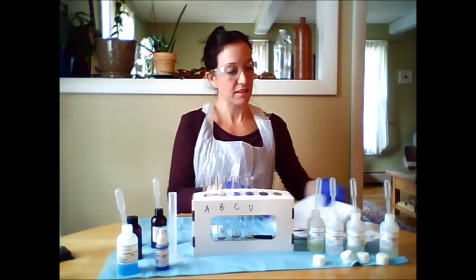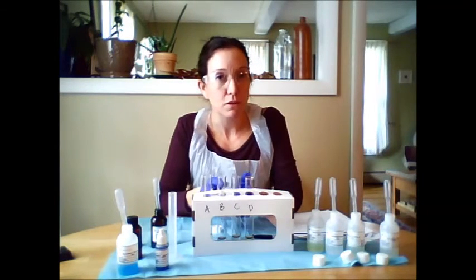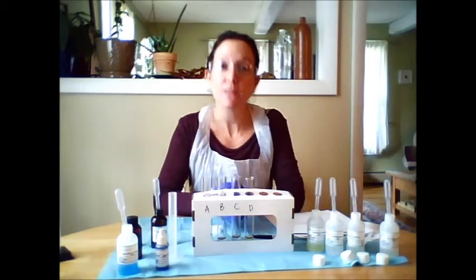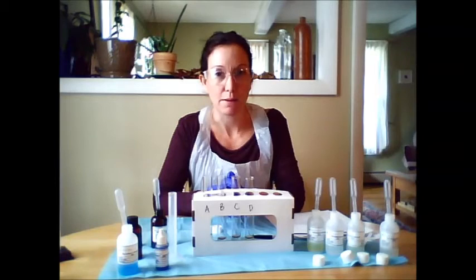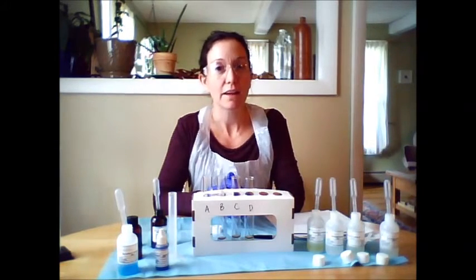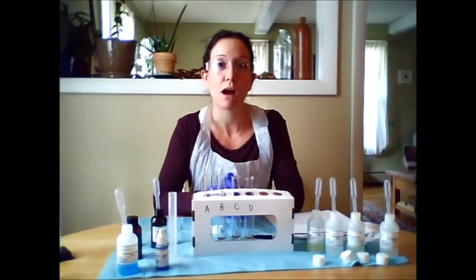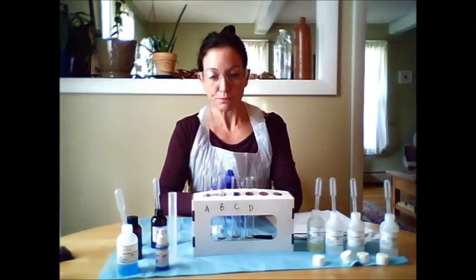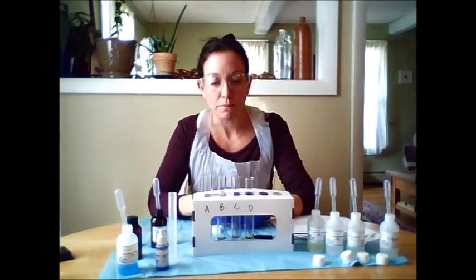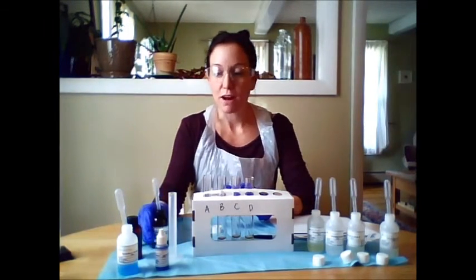Okay. The third test in the urinalysis is a test for yeast. I wanted to perform this one because in the last lab, in the enzyme lab, you tested the reaction of catalase enzyme on hydrogen peroxide. Catalase is an enzyme found in yeast and other organisms. Catalase facilitates the breakdown of hydrogen peroxide into oxygen gas and water. So, if yeast is present in the urine, it will break down hydrogen peroxide.